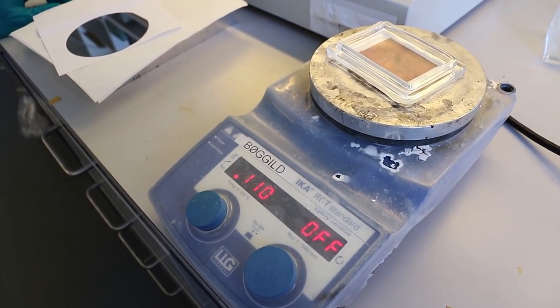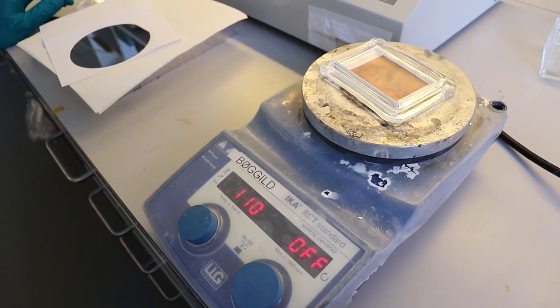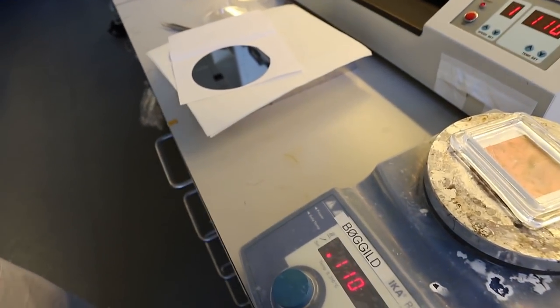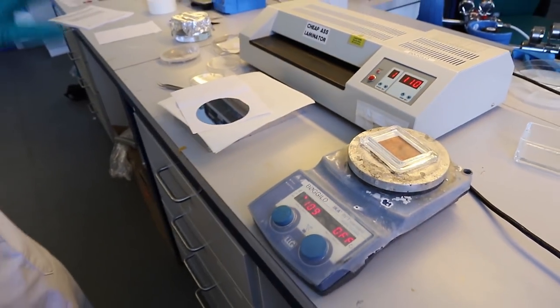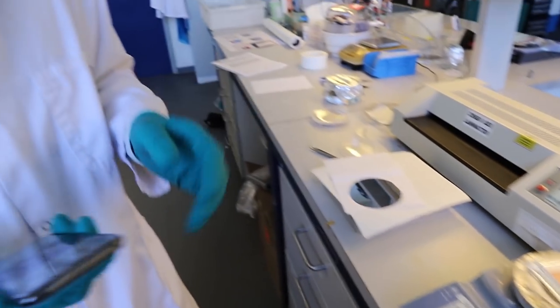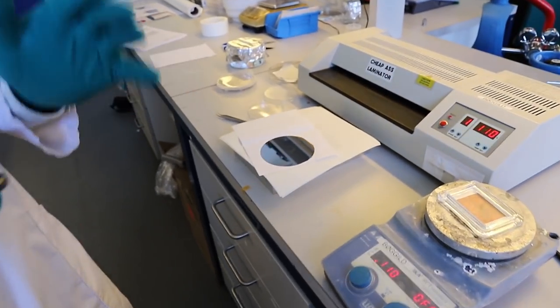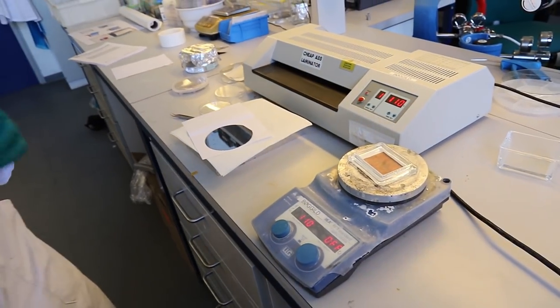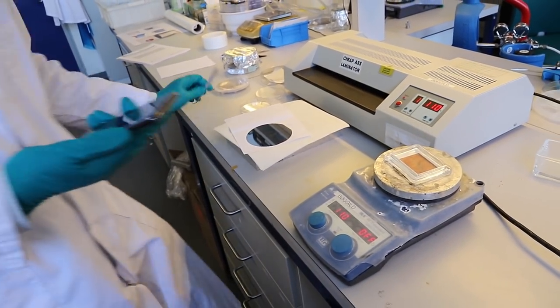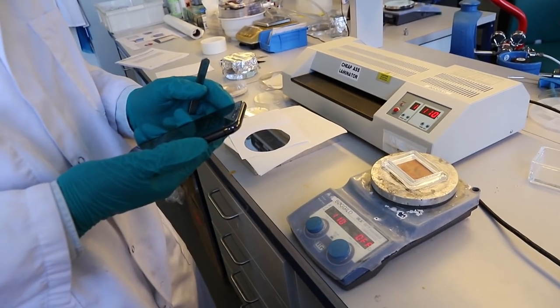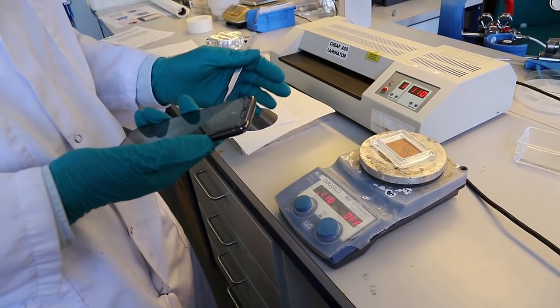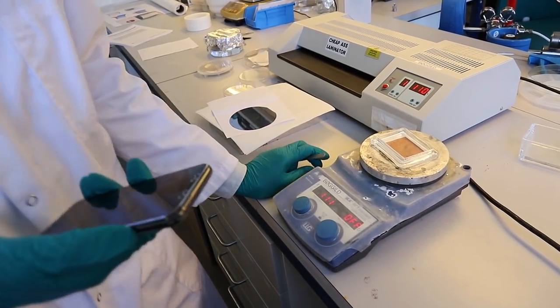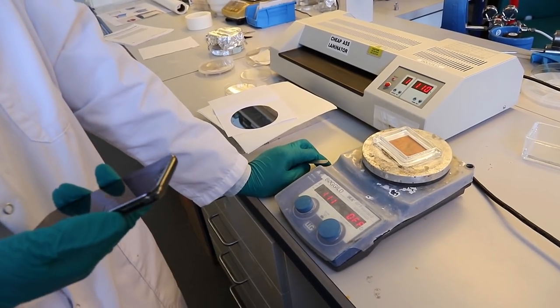We wait for about 30 seconds, so now is a good time to get a coffee. But since we are in the lab and we're focused on doing our work, we're going to stay here and wait for just 30 seconds. Is that enough? 30 seconds is enough but I usually just give a bit more.